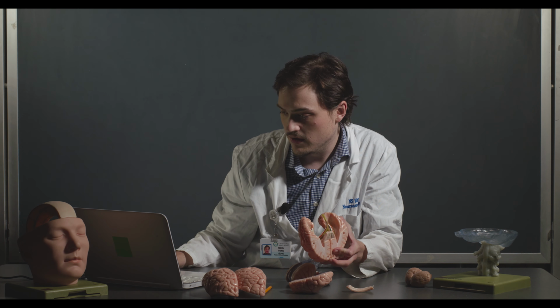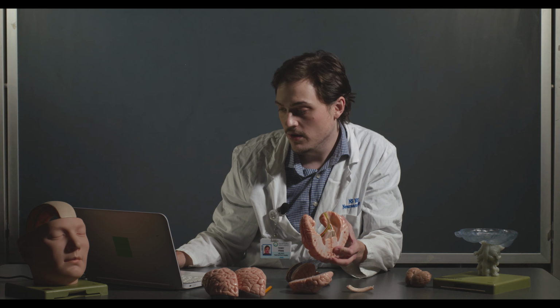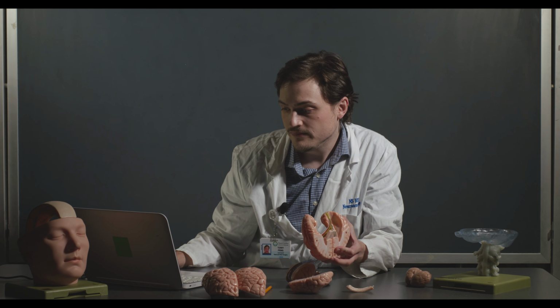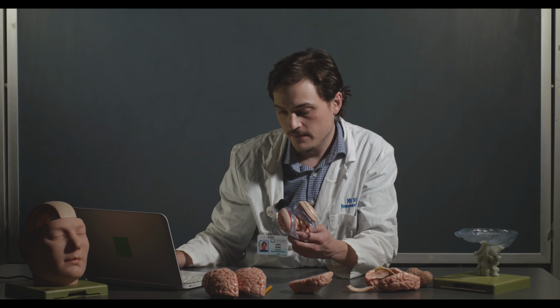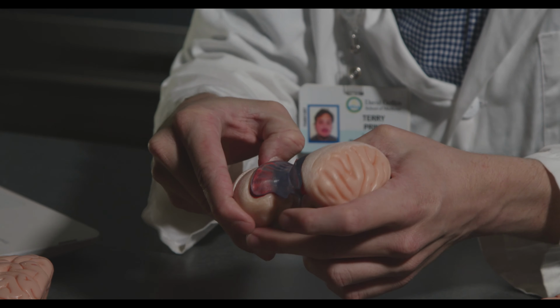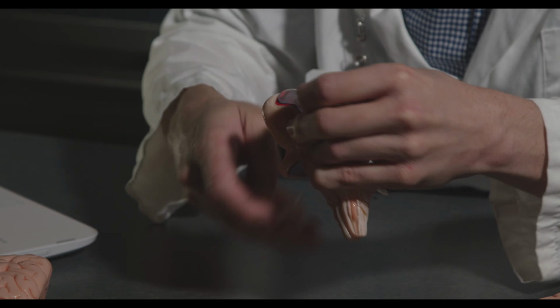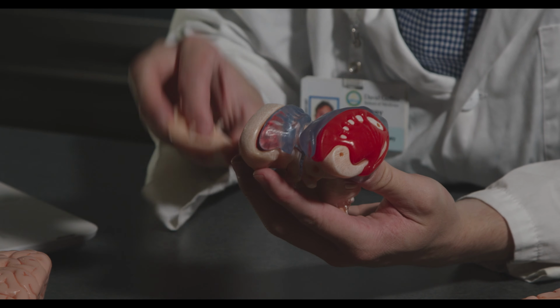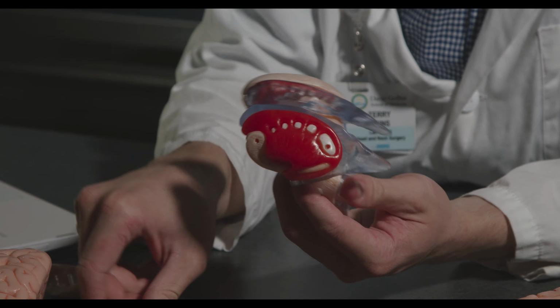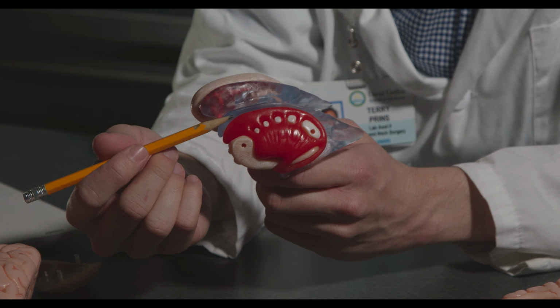Again, focus on the labeled terms, like the red terms or the stuff that's circled in a red circle or a red box. And then the last thing I want to show you is on this model. I'm going to take away the insular cortex, if I can get it off, so you can see. If we were to remove the insular cortex, just medial to that on the inside, we can see the basal ganglia structures.